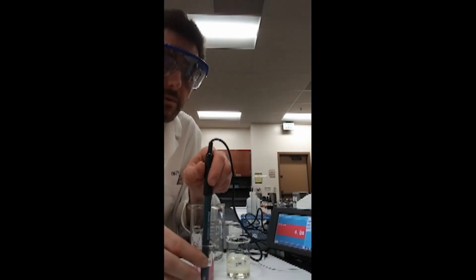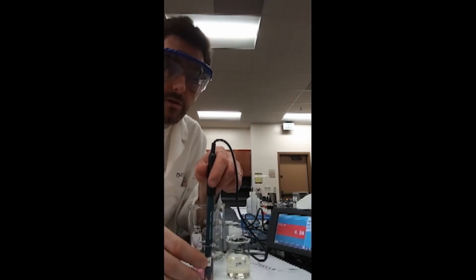This two-point calibration, not always essential for the use of these probes, is a typical step for most probes.